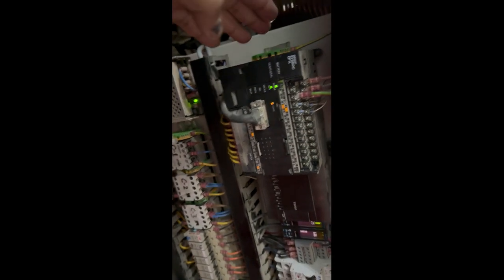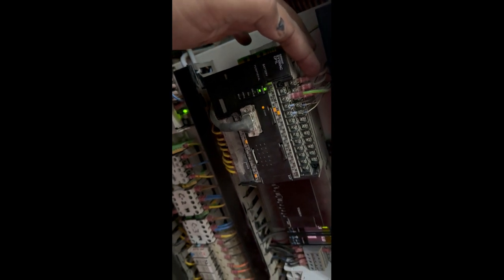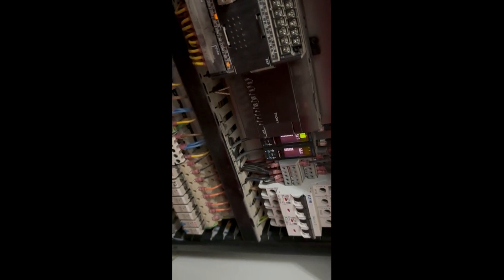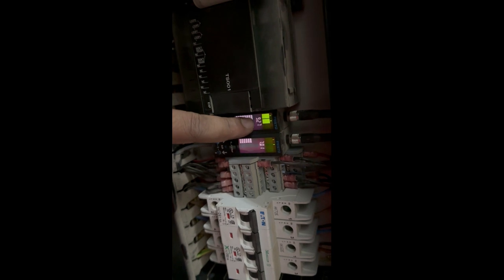Here in the geometry of the system, we have the PLC, and here we have the communication cable for the PLC. These are the power supply cables, 24-volt power supply, and the rest of the inputs and some outputs are also there. Here we have the IO card, input output card, and pressure switches: the pressure switch for nitrogen, and here is the pressure switch for air. Here you can see the pressure. This is the pressure switch for the nitrogen, and set point A and set point B both have been reached.